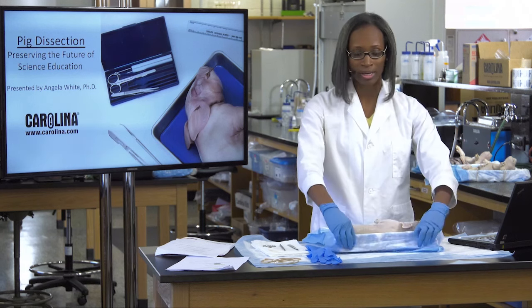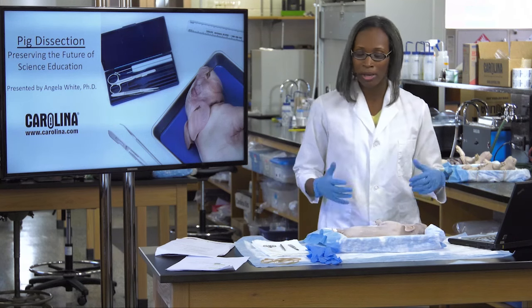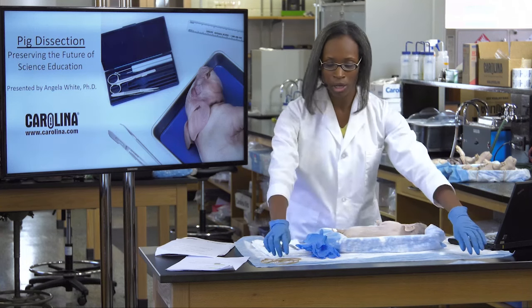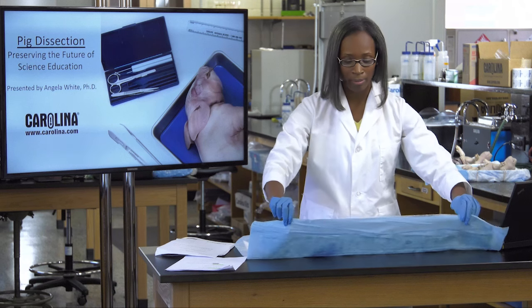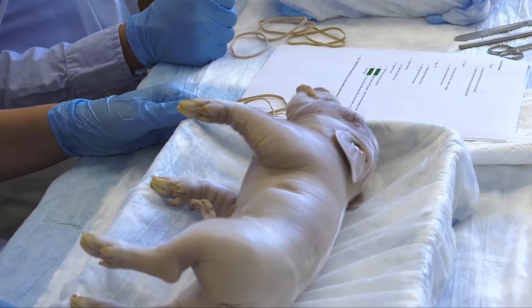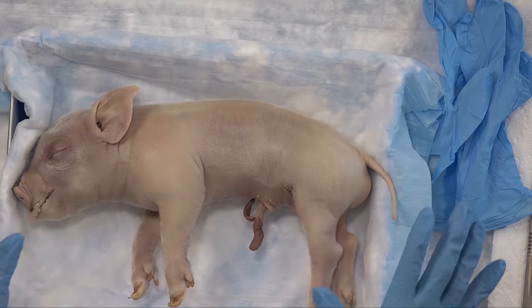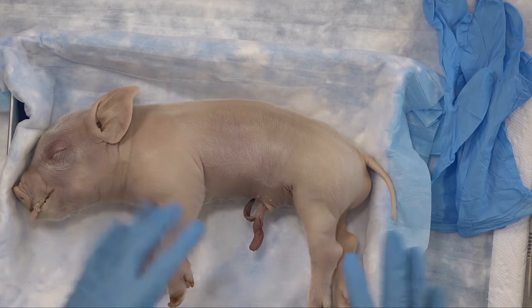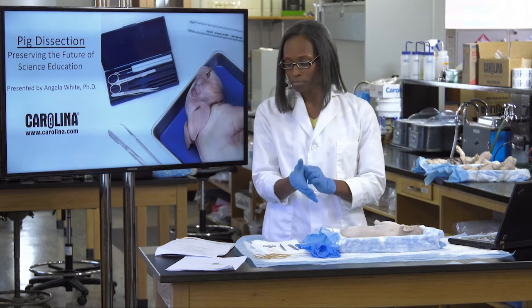As we've prepped our pig ahead of time, there are a couple of things to ensure it's not very messy. Definitely for sake of time, you may not have a whole lot of time for cleanup. I have a blue absorbent pad underneath the pan, and I've placed my pig on a blue absorbent pad inside the pan as well. If you don't have blue absorbent pad, feel free to use paper towels — you want something to draw up the fluid released as you cut into your pig. Place the blue absorbent pad with the white cotton side facing up.